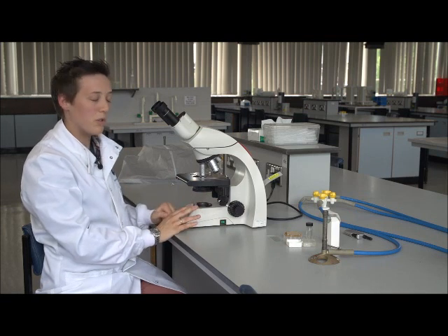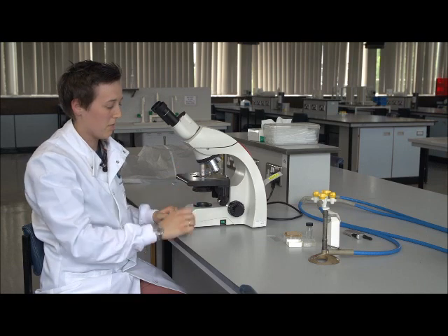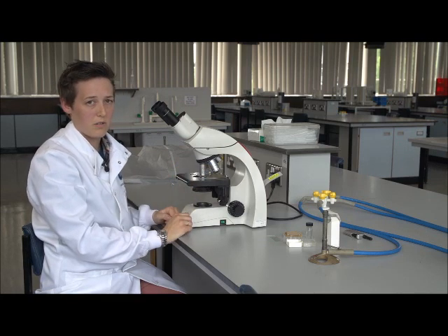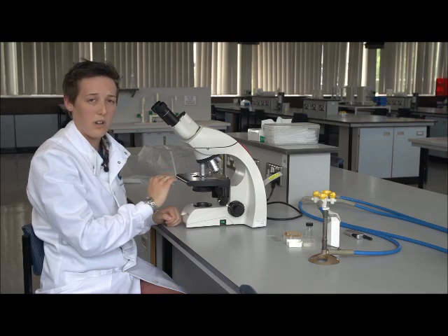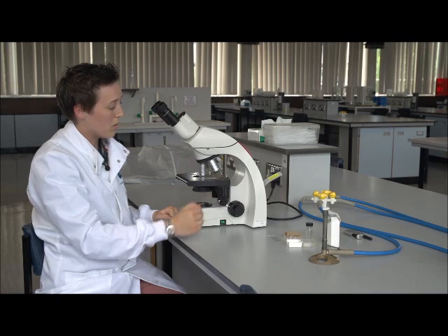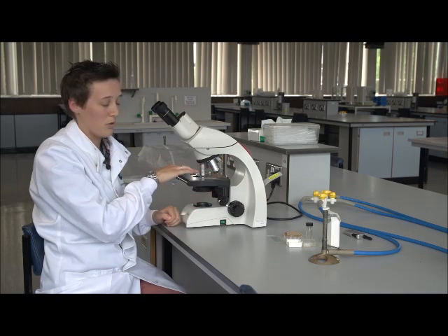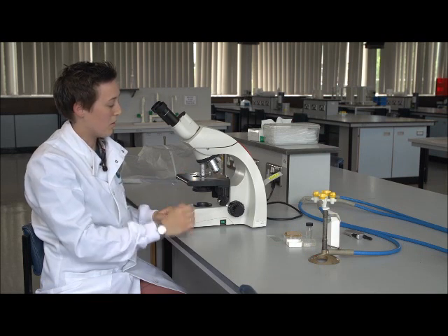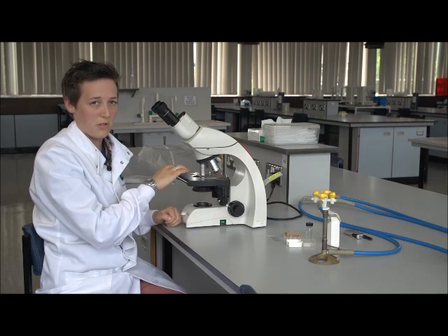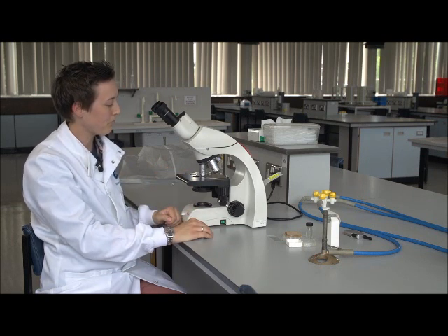And now, if we want to move to 100 times and use the oil objective, then we need to be really sure that we're completely happy with our sample and our focus at 40 times before we move to 100 times. The oil that we use for the 100 times cannot go onto a dry lens. It can dry on and even damage any dry objectives that we're using. So we want to be absolutely sure that we're ready to start using oil.